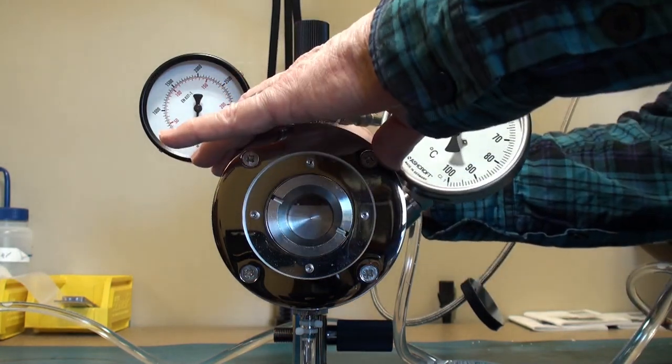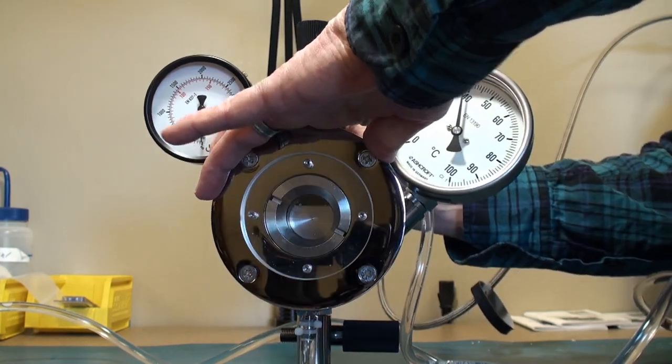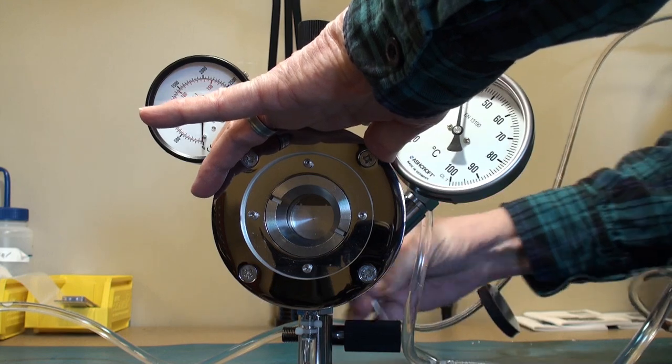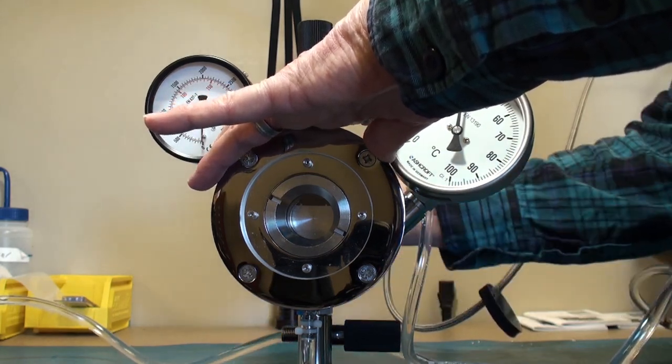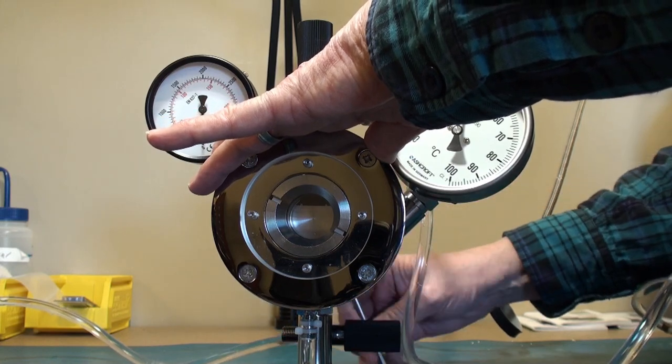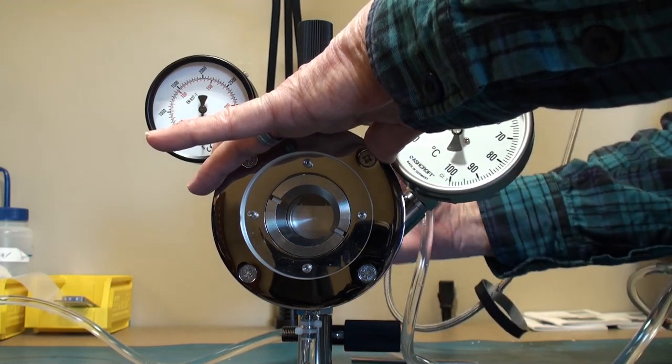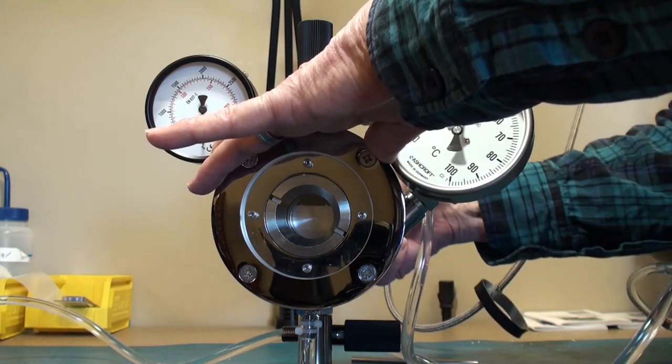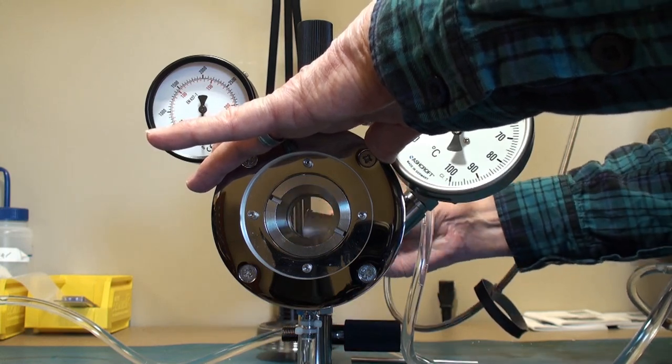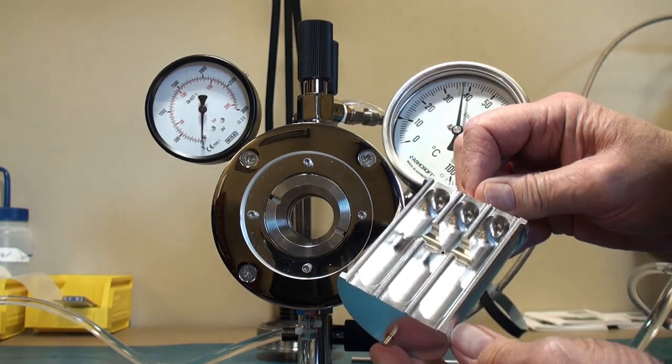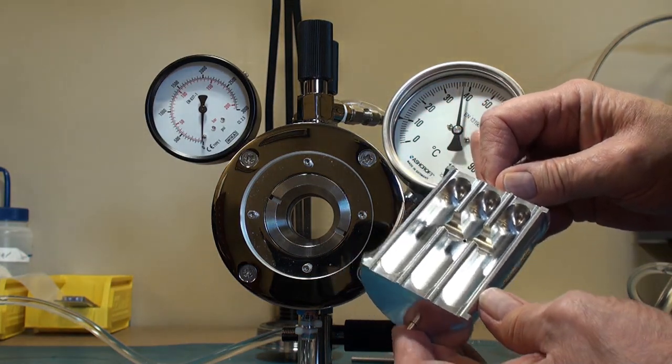If and only if all the pressure has been relieved from the chamber, will you be able to unscrew the back and retrieve your now dried samples.